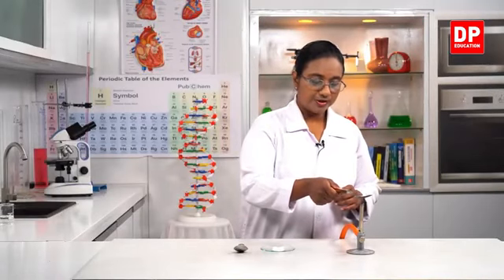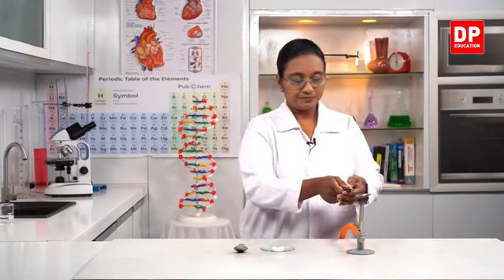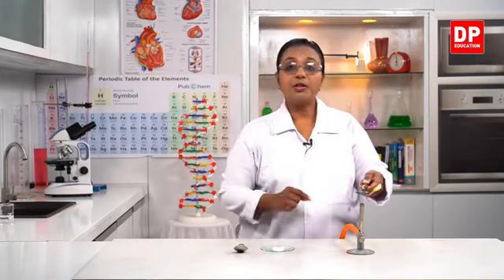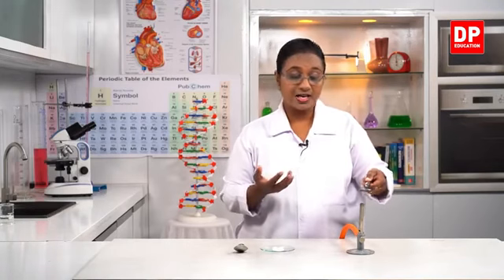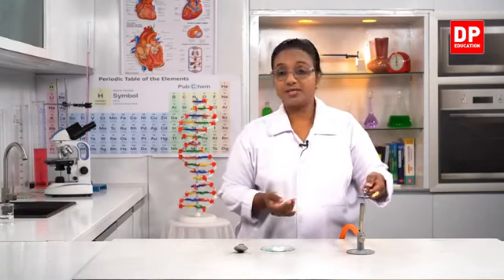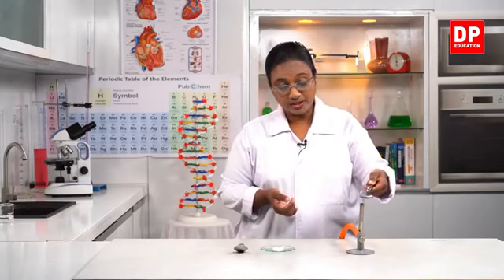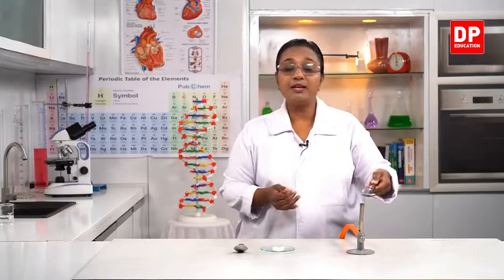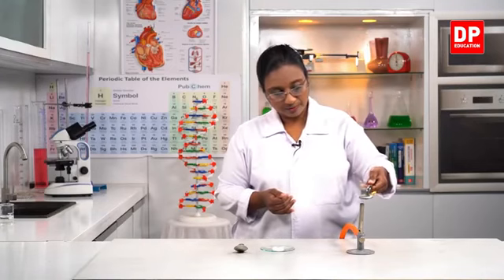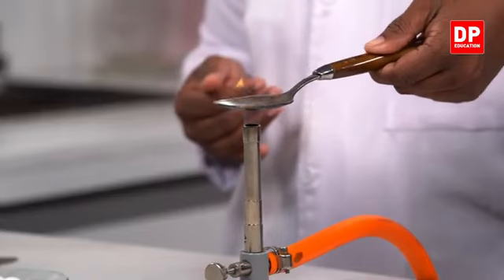Right. So we will need to first heat the spoon. It has to be heated strongly. So I will hold it for some time so that it becomes really hot. Now students, if we put the mothball and heat the spoon, then of course there is a high chance that while in the flame itself, the mothball will vaporize and it will enter the atmosphere. So we won't have anything remaining in the spoon. That is the reason why we need to heat the spoon first and then put the mothball after removing the spoon from the flame. So I have to make sure that it is heated strongly. So that's why I'm holding it for a longer time.